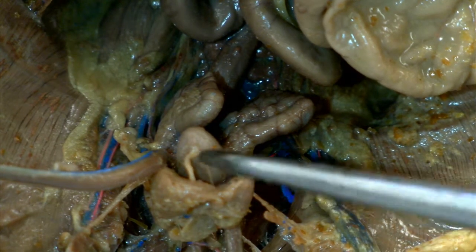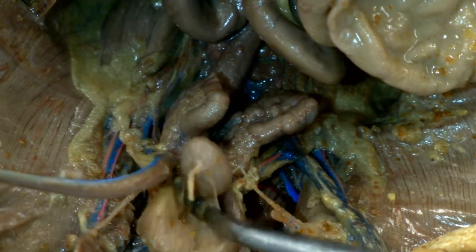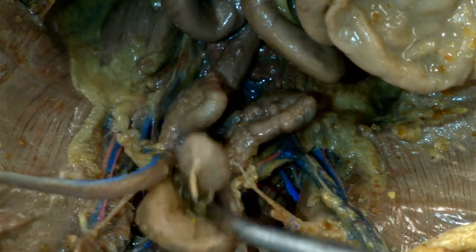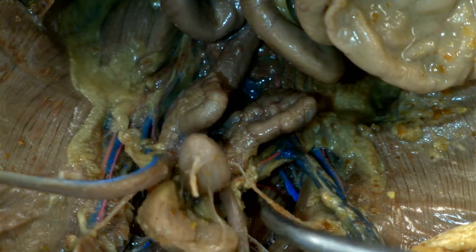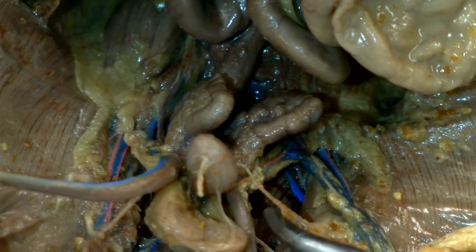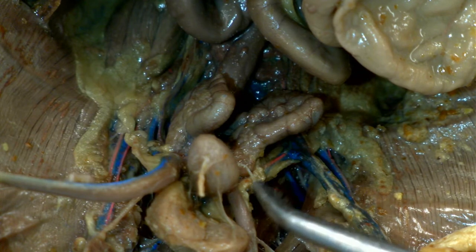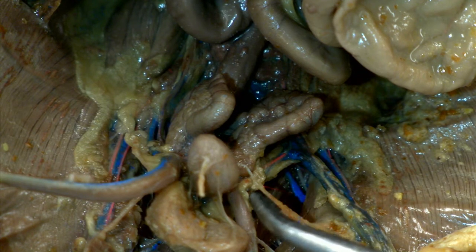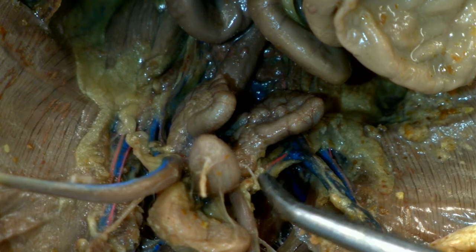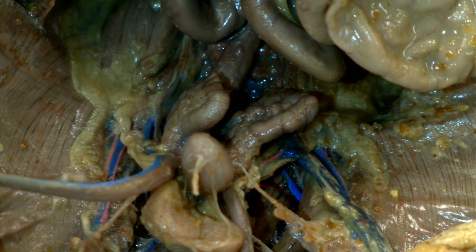Now there's one other gland that is nestled in between the prostate and the bladder. I suspect this might be part of the tissue right here, and this is called the ampullary gland.